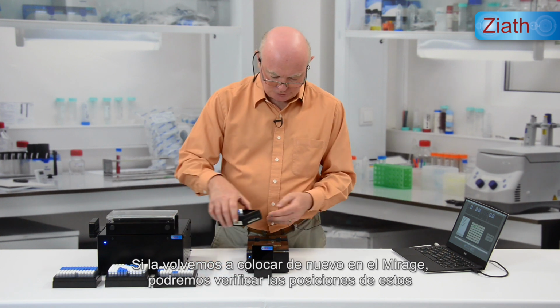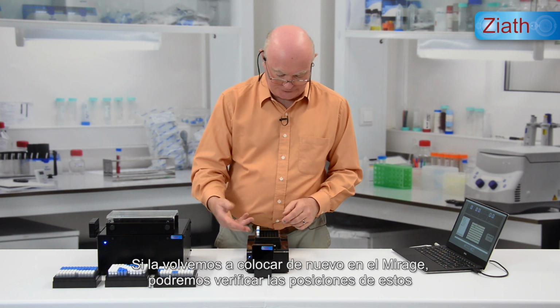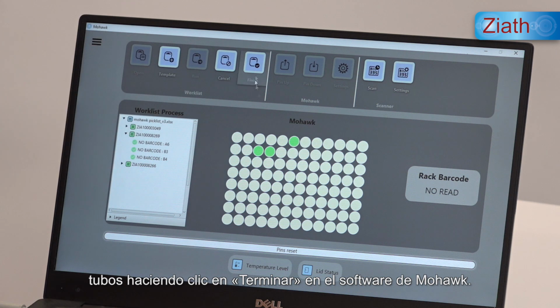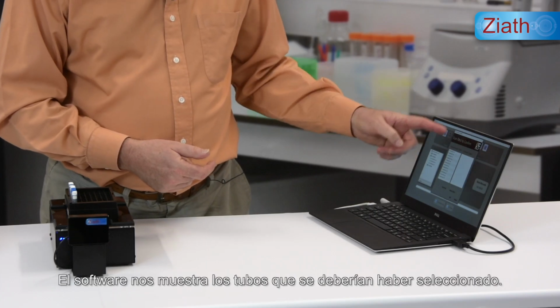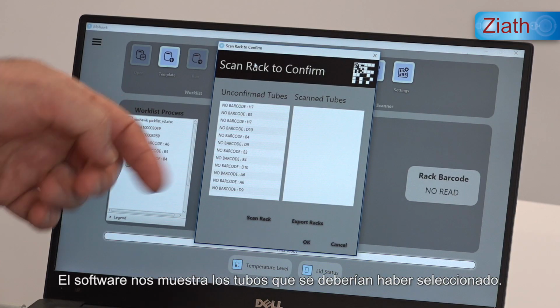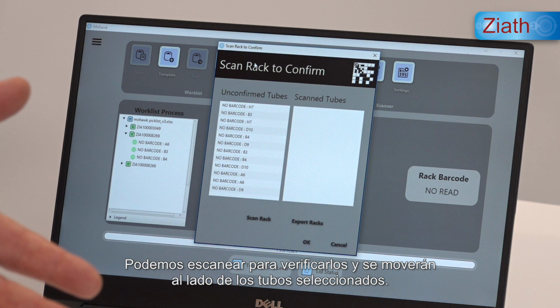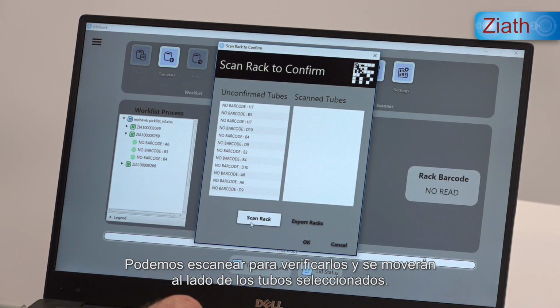We can put it back onto the Mirage and verify the positions of these by clicking Finish on the Mohawk part of the software. We can see from the software the tubes which it thinks have been picked, and then we can scan to verify them and they'll move across to the picked side. Scan rack.